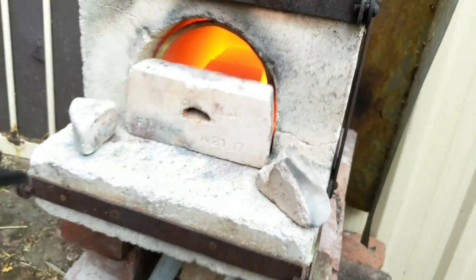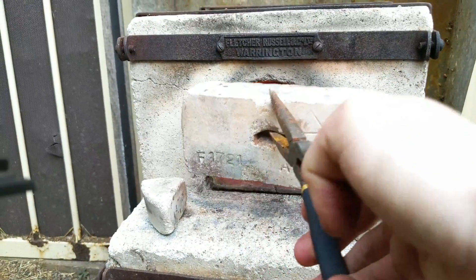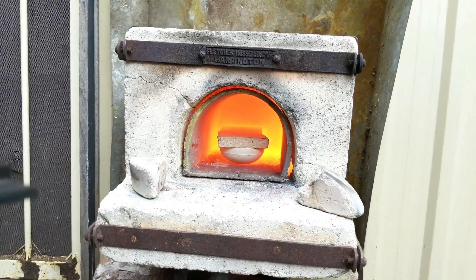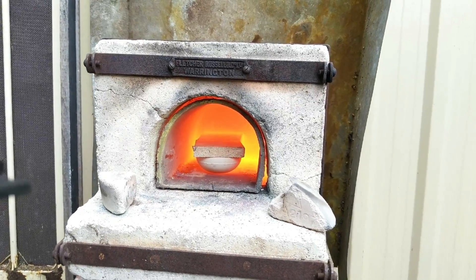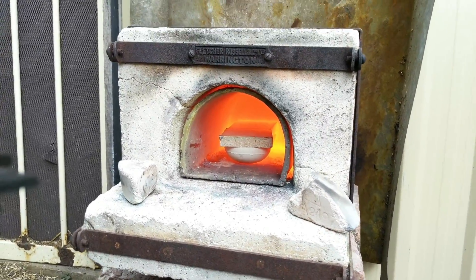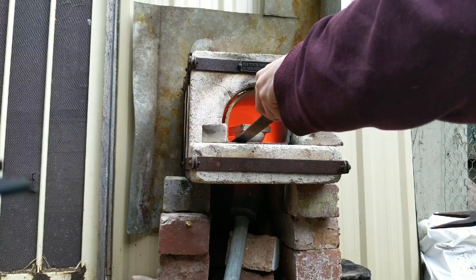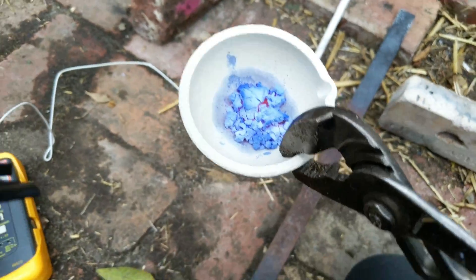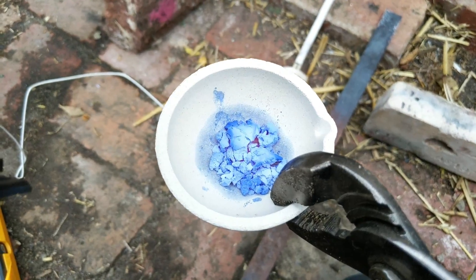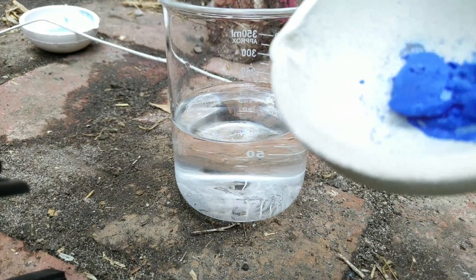I don't do this with gloves because if the gloves overheat then I won't know that my hand is about to burn — whereas if my hand is too hot I'll know. And there we have it — just cruising at about a thousand degrees in there. The crucibles are very hot. The blue looks molten in colour. I think I'm supposed to rapidly cool at this point but I'm not sure. This pigment here has just come out.